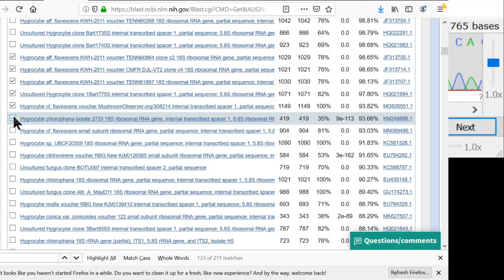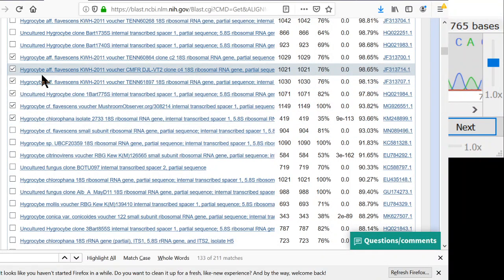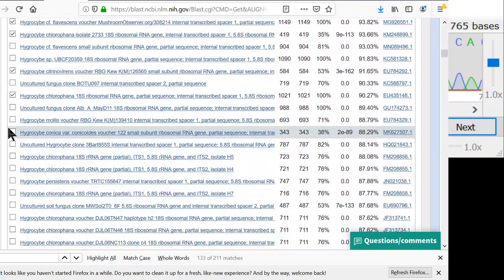Hygrocybe chlorophana. Hygrocybe flavescens is a name from Michigan. That's where it was discovered. So adding sequences in here from Michigan is really important, because if you get the sequence from Michigan, you can be really sure that you're getting the right name, and you actually know what the real flavescens is, which is pretty important. Here's another one, Hygrocybe citrinovirens, chlorophana.